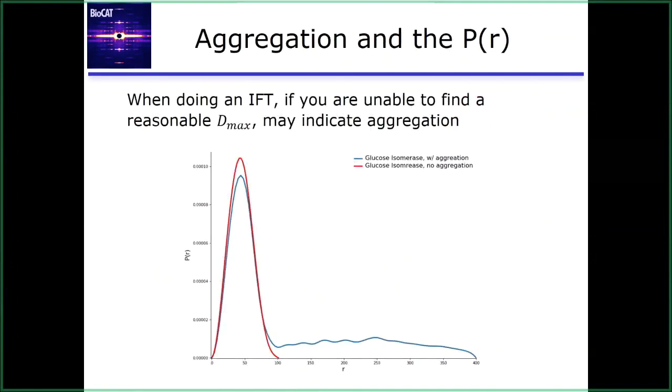So, aggregation and IFTs. This is very characteristic. Here's the same protein with and without aggregation. When you have aggregation and do an IFT, you'll see that you get this long tail that just extends out and out and out. I've actually run this out to about 4 times the maximum dimension. Even at that point, you can see I'm still forcing it to 0. So there are a lot of variable size aggregates in this system, and it's not coming to any conclusive maximum dimension.